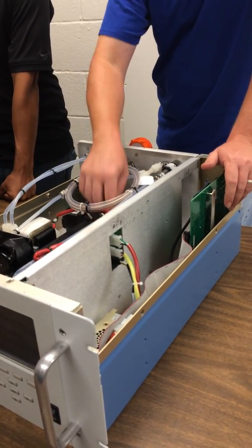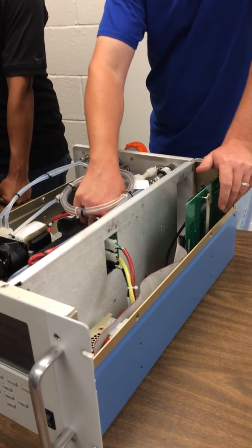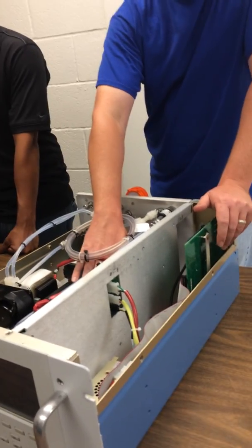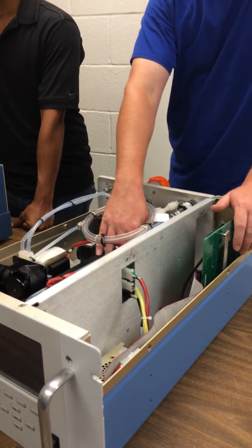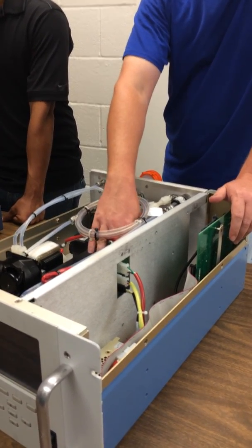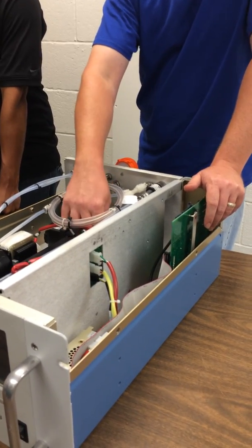What this does, there's a valve up here that lets us select routing this through. So the bench is hot. This is connected to it, so this is also hot. This is a catalyst like in your catalytic converter in your car. It oxidizes CO to CO2. We don't measure CO2. So this is our zero.